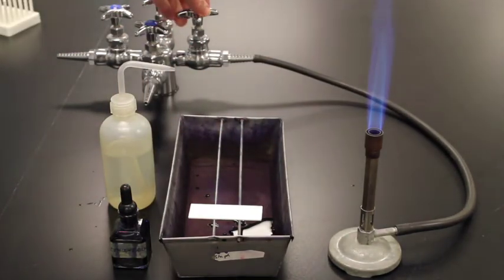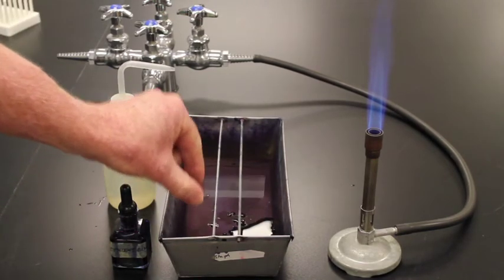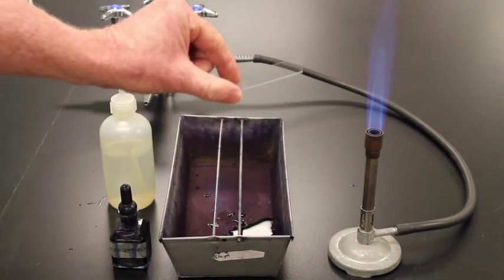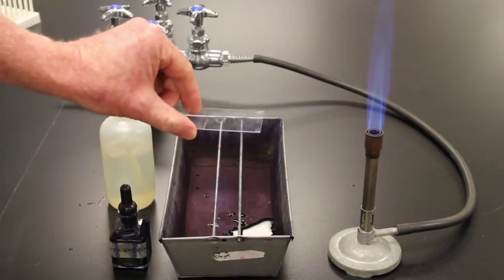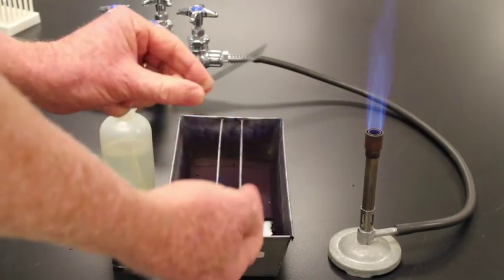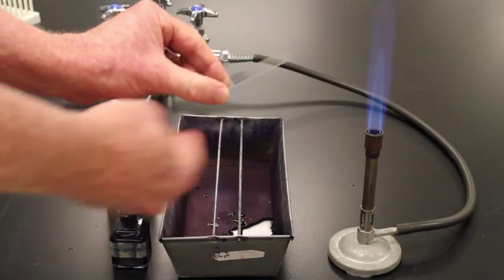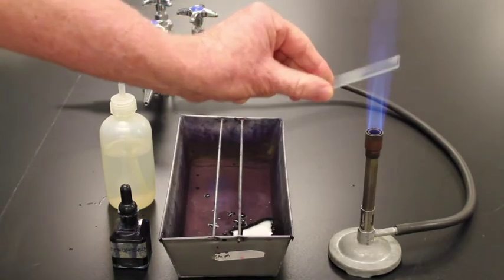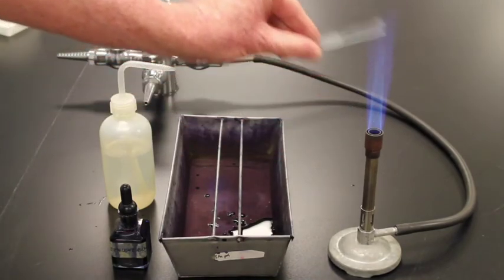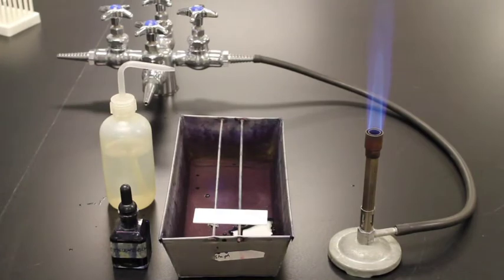Okay, we'll get a nice flame going. You see that nice cone on that Bunsen burner there. I'm now going to take my slide. I'm going to just go over slowly twice over this slide, counting 1 Mississippi each time. I'm going to angle the slide away so when the flame hits it, it goes that way. You know, a lot of people use clips so that they are a lot farther away from their fingers. So we're just going to go 1 Mississippi, 1 Mississippi. And put that there, and then we'll be set.